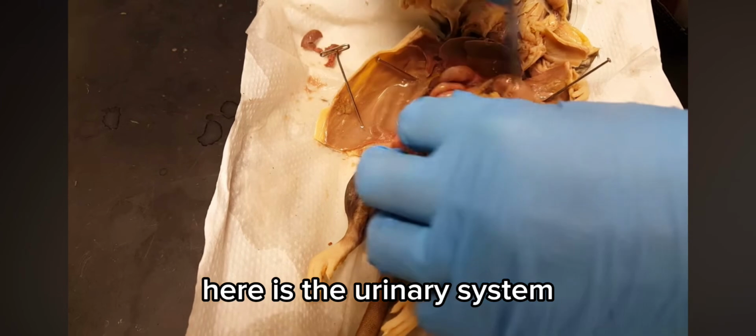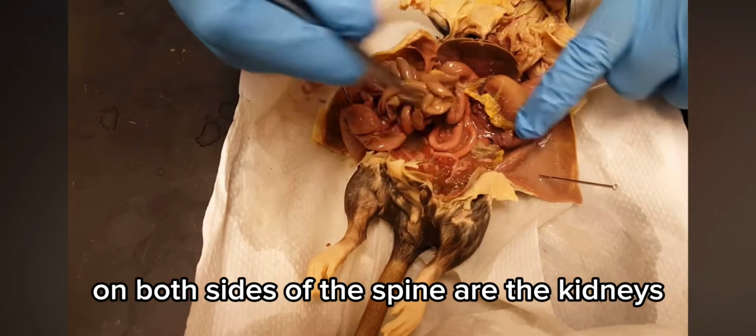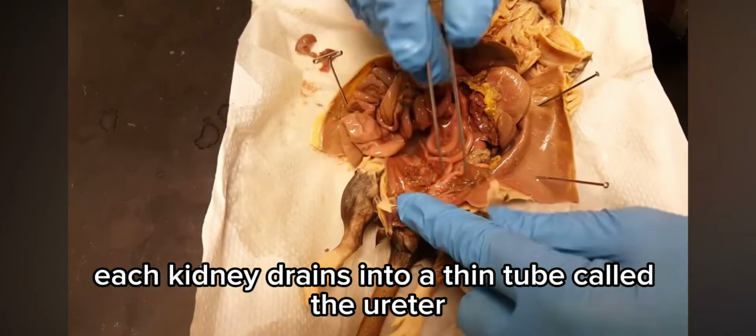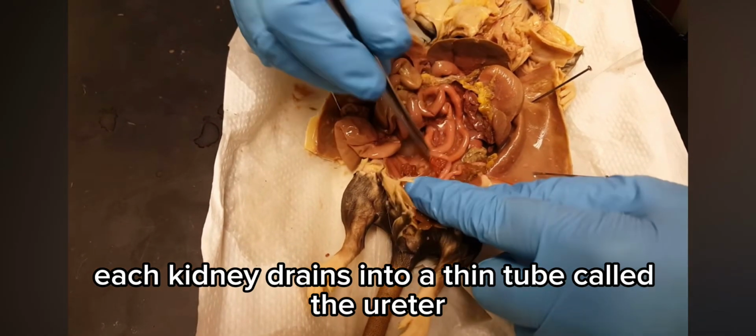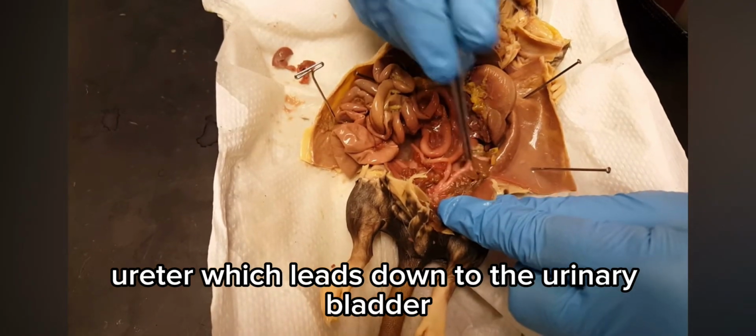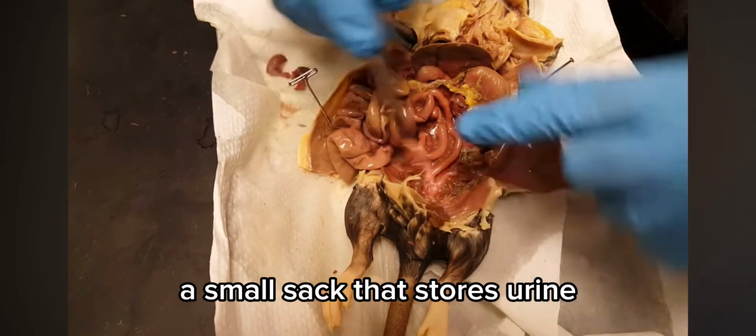Here is the urinary system. On both sides of the spine are the kidneys, which filter waste from the blood. Each kidney drains into a thin tube called the ureter, which leads down to the urinary bladder, a small sac that stores urine.